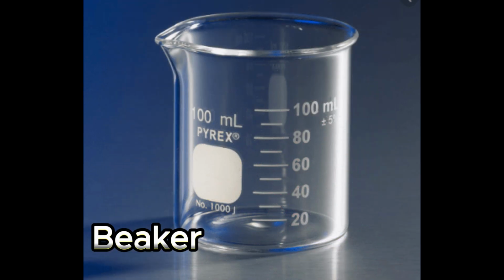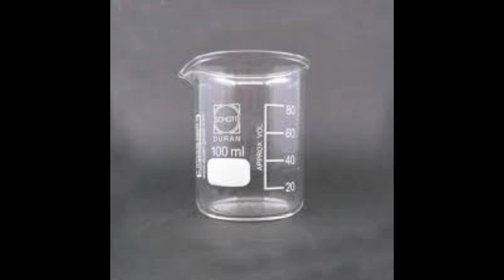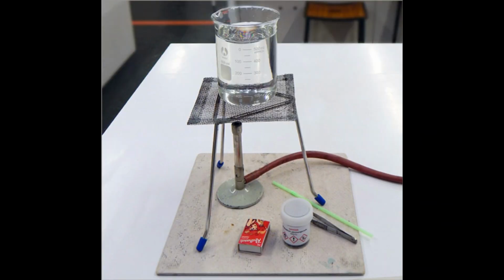Beakers are one of the most commonly used types of laboratory glassware. They are cylindrical-shaped containers with a flat bottom and a spout, for holding and mixing liquids. Beakers are primarily used for holding and mixing liquids. They come in various sizes, ranging from a few milliliters to several liters, allowing researchers to work with different volumes of liquids.